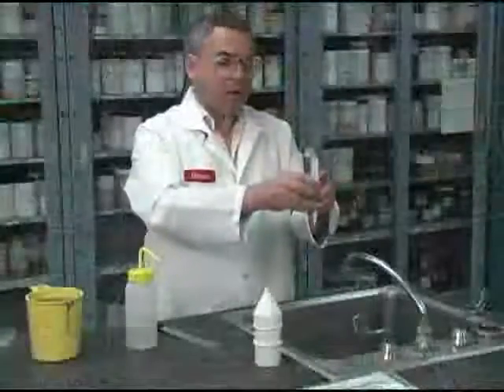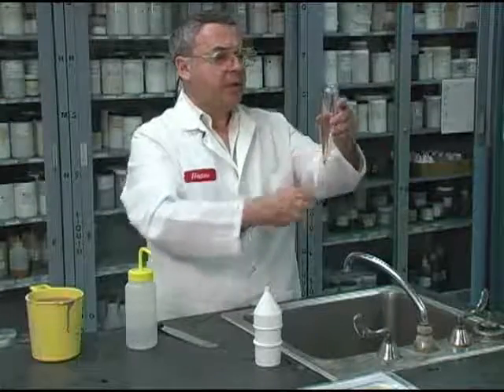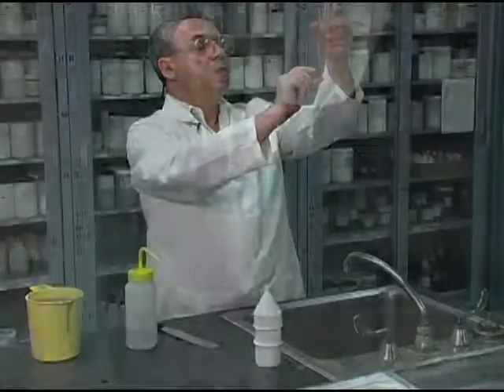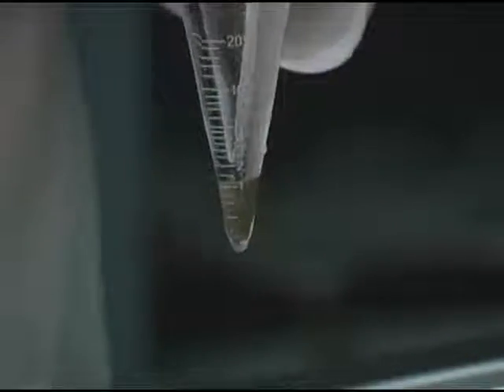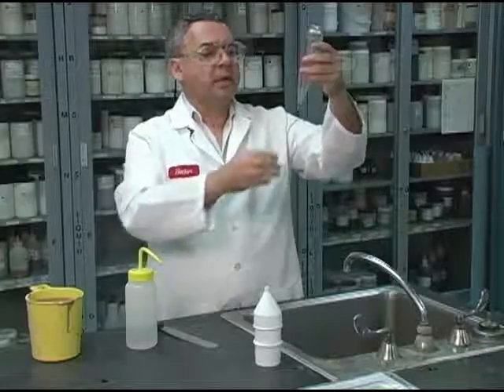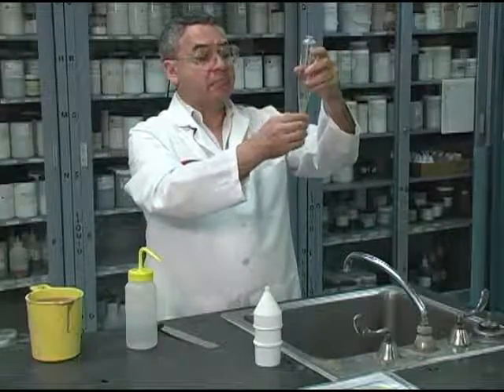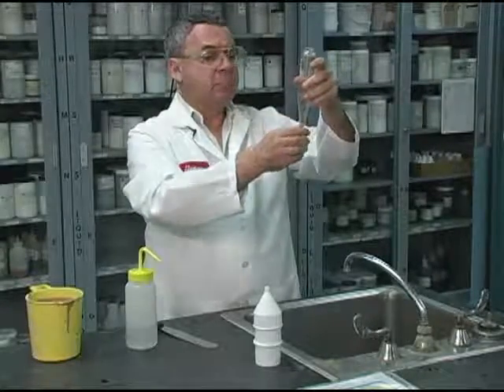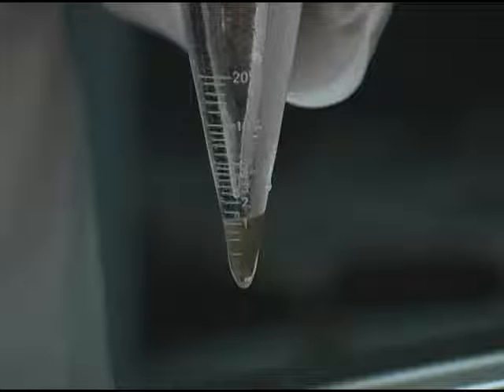So all the sand I caught with the screen is now here, where I can read, in this particular case, 1.25% sand content. I can see that this is very brown and this is pure sand. It's not barite or lignite. Barite would give me a very white color, lignite a very black color.